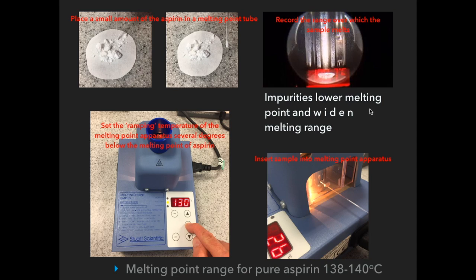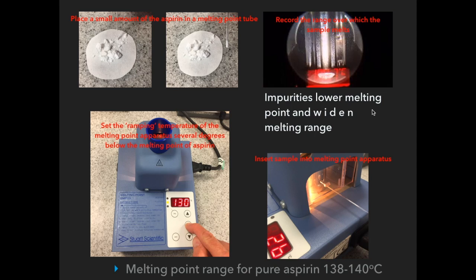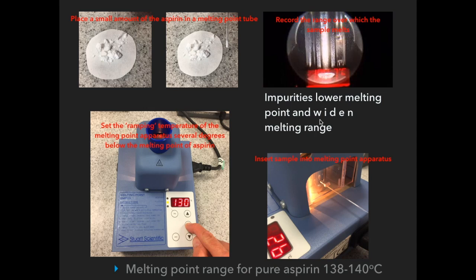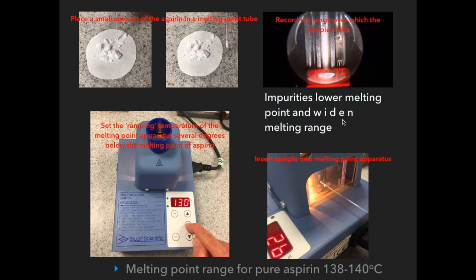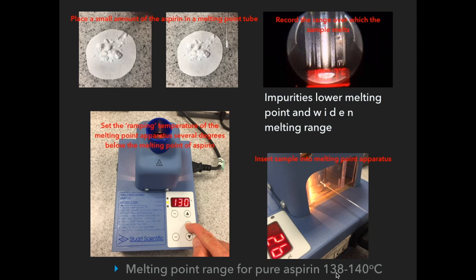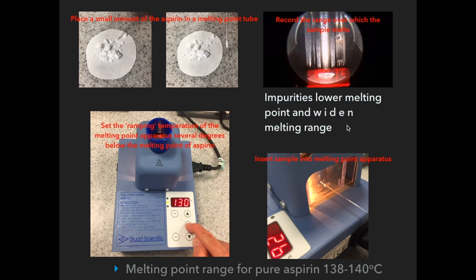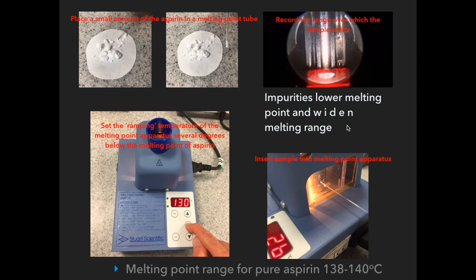To determine purity: impurities lower the melting point, so you'd expect a melting point lower than 138 degrees, and the sample would melt over a wider range. Impurities lower the melting point and widen the melting range. Pure aspirin melts over a small 2 degrees Celsius range, whereas impure aspirin will melt over a wider range — the wider the range, the more impure the sample.